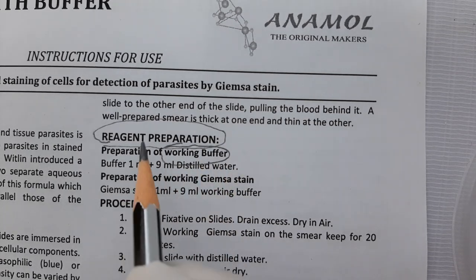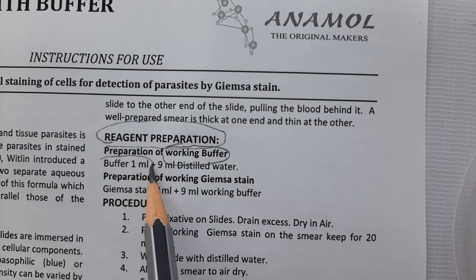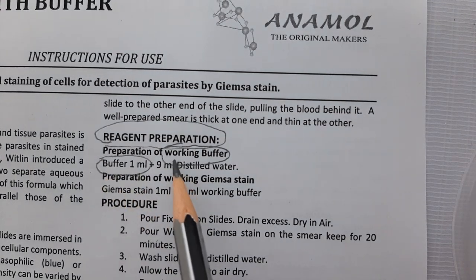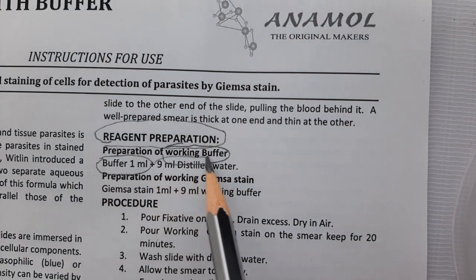To do this, we need to take 1 ml of the buffer which is provided in the kit and mix it with 9 ml of distilled water.